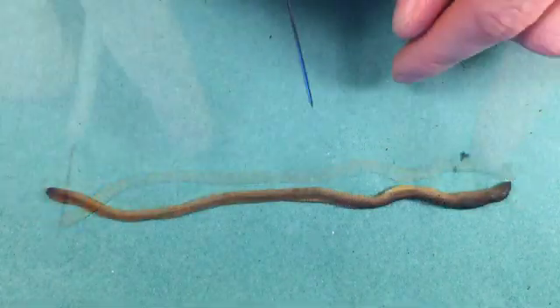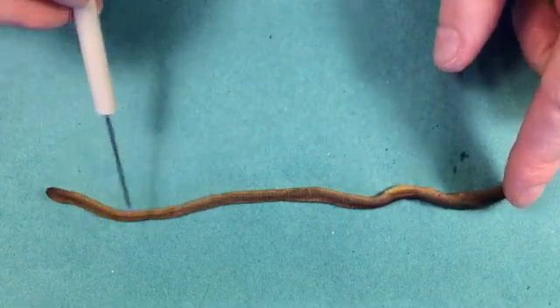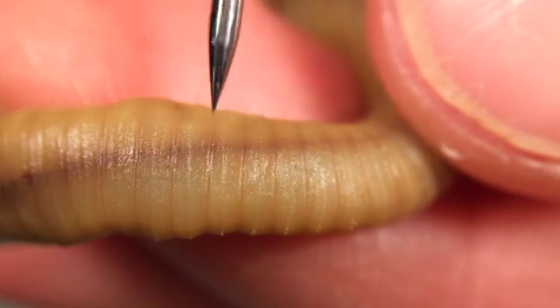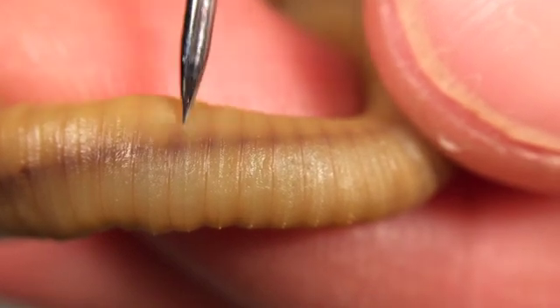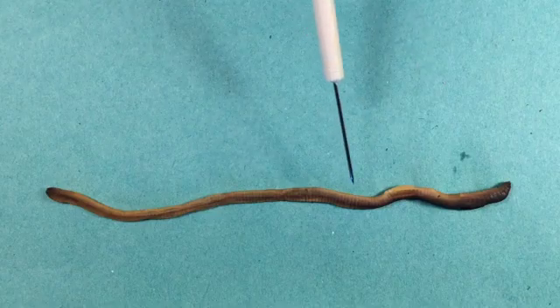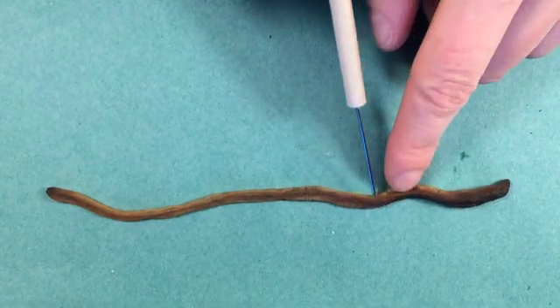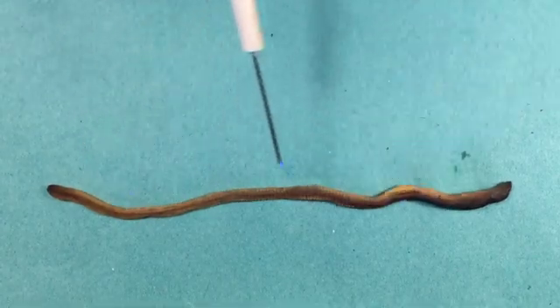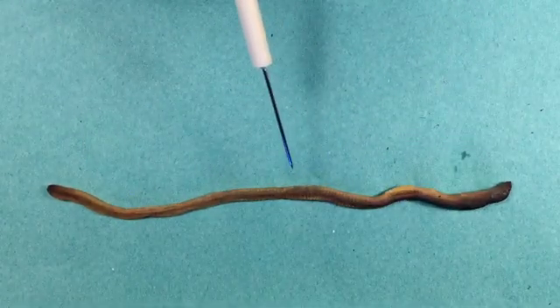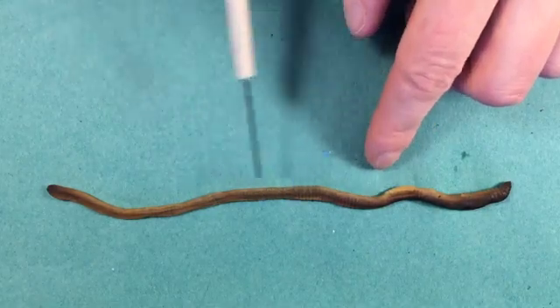An important feature of the earthworm is that the whole body is segmented. Each segment is defined by two furrows either side called the intersegmental furrows. The segmentation in earthworms is what we call metameric, because the segments are basically identical to each other. All the segments posterior to the clitellum will contain, for example, the intestine, nephridia, muscles involved in locomotion, ganglia, and setae — so they're all pretty much identical.